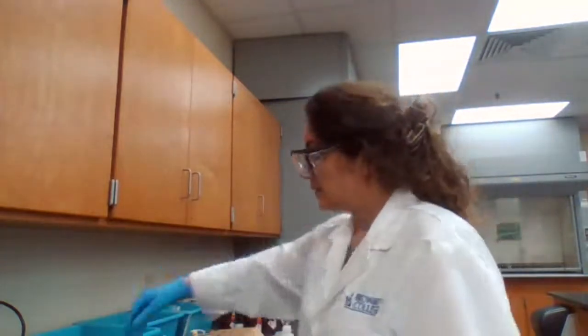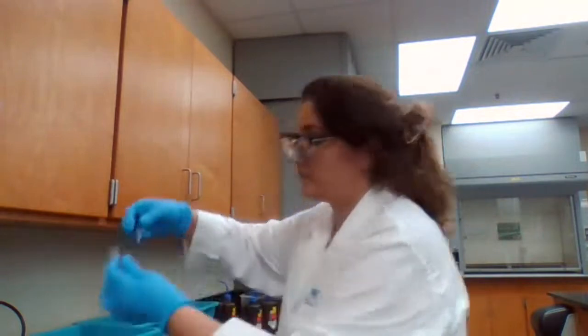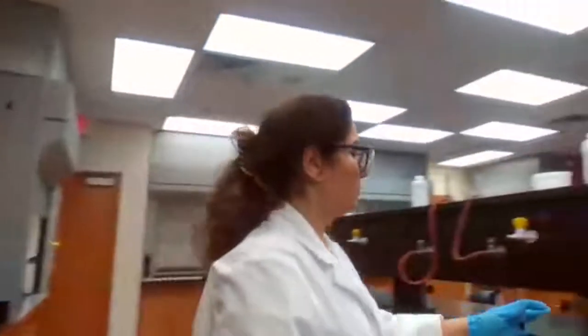And 5 drops of hot water. We'll have the hot water here.